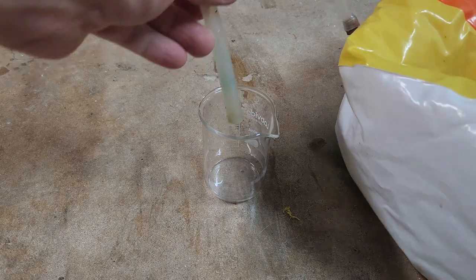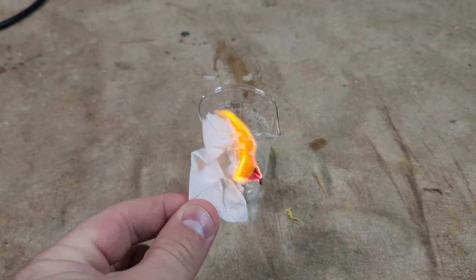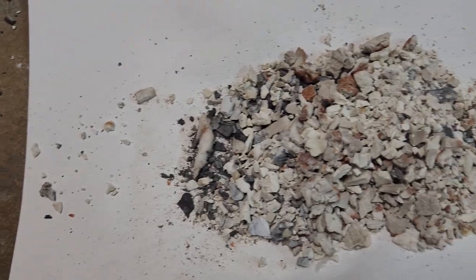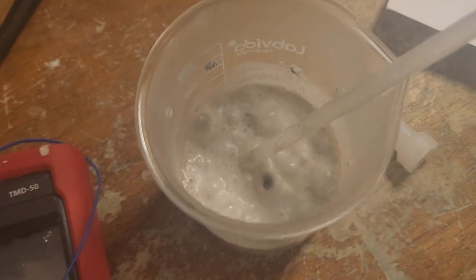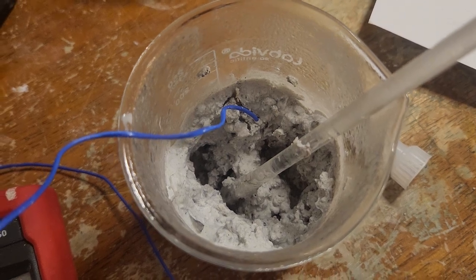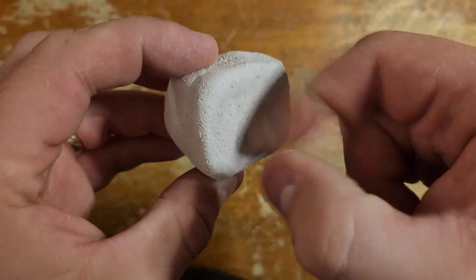We can verify this is CO2 by squeezing a little bit into a beaker and dropping a burning piece of paper inside — the paper is instantly extinguished and doesn't even smolder since there's no oxygen. The other way to verify CO2 was released is by slaking the leftover lime — it goes absolutely crazy and bubbles all over the place when water is added. Even around a minute after the reaction peaked my thermocouple still read over 100°C. The slaked lime turns into a powder that makes a really fine slurry in water, and I managed to make a neat little brick out of it after drying for a few days.